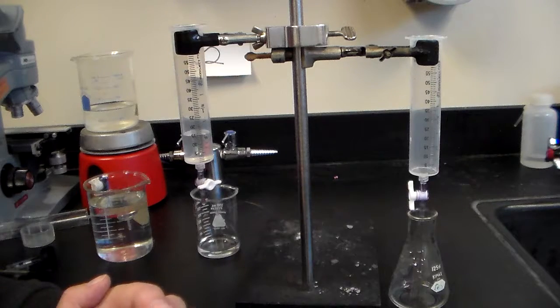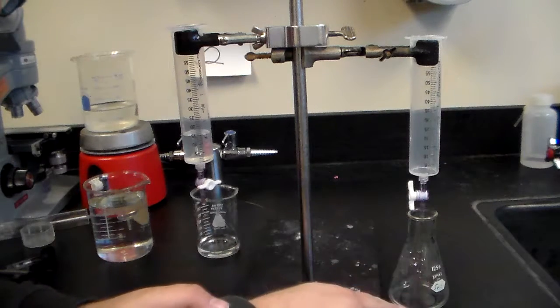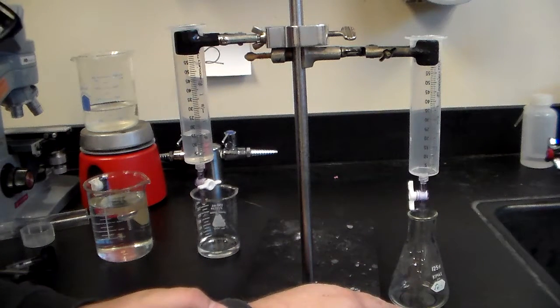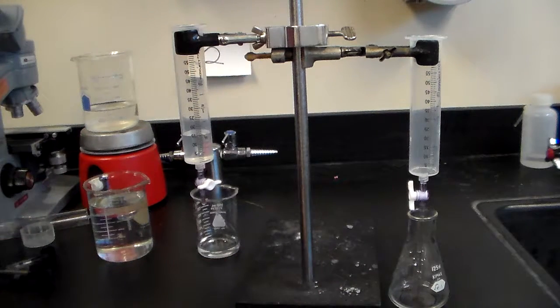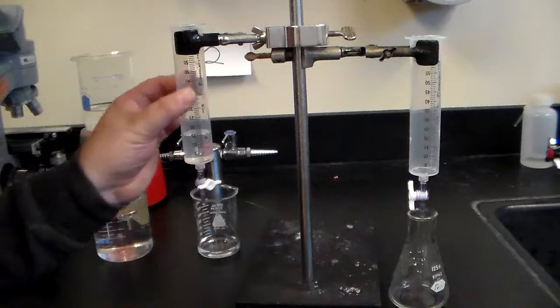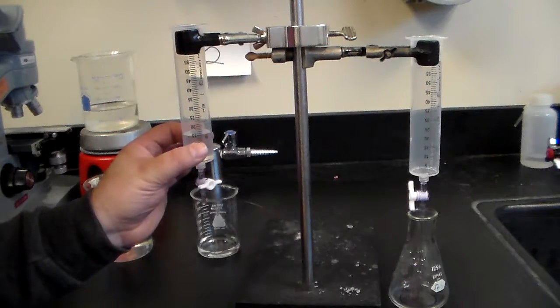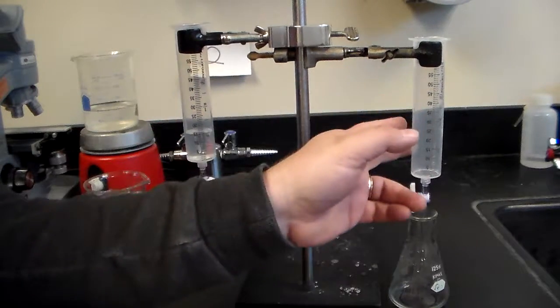The indicator is going to tell us at what pH we are roughly at. When the indicator goes green, when it turns green, the solution then you've reached the end point and you can record how much acid you've used and how much base you have used in milliliters. We can do the calculations later for that.